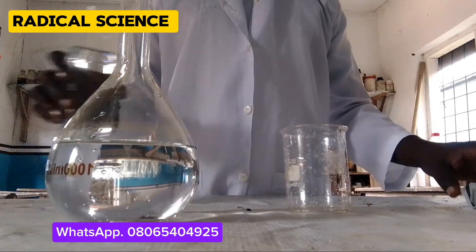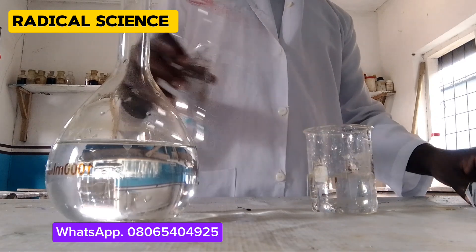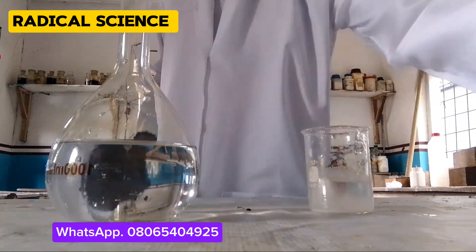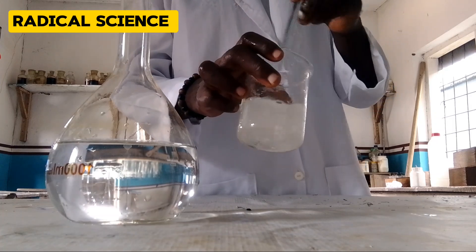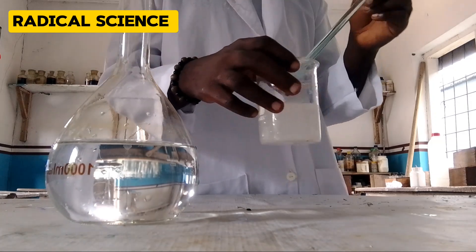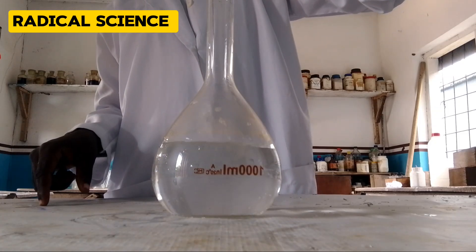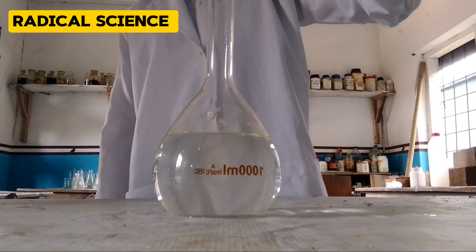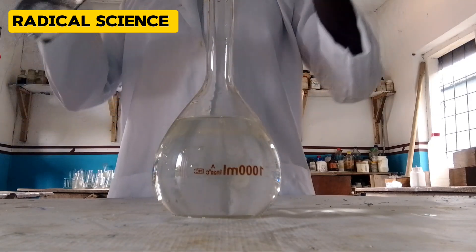For now, I'll be preparing the sodium carbonate which we'll be using for the titration. As a student, you don't really have any business with this because your lecturer will be providing you with an already prepared solution. All you need to do is carry out the titration and get your end point. For those who still want to learn how to prepare it, just follow my previous videos where I show you step by step how to prepare these chemicals.